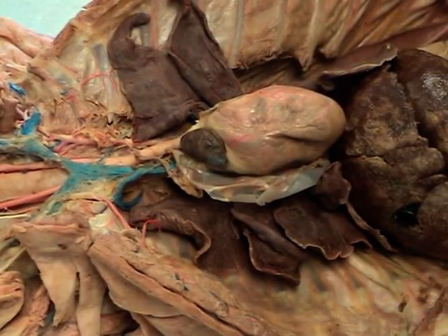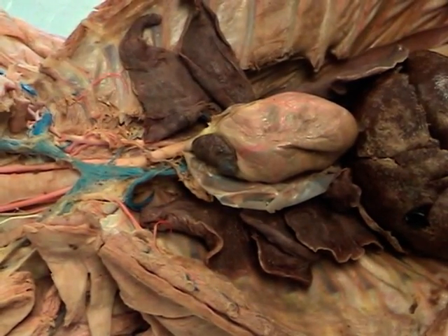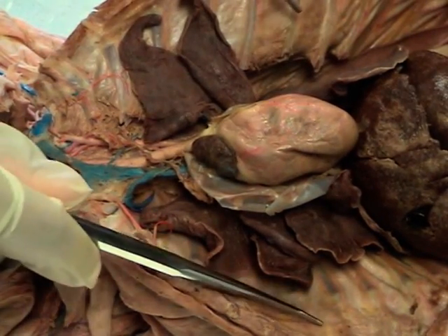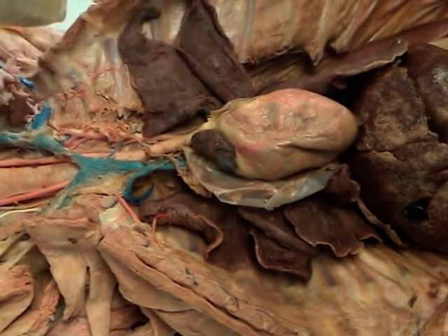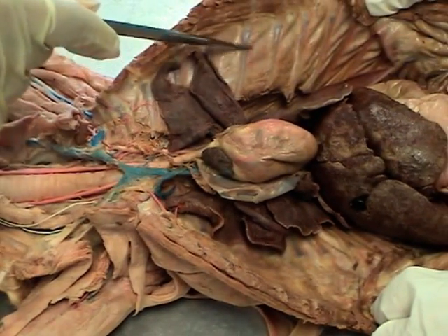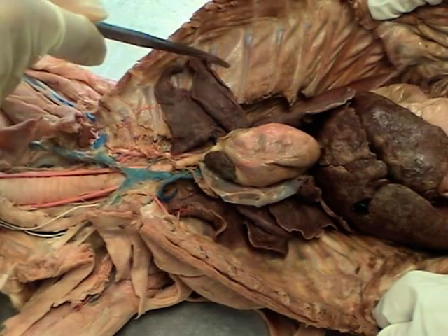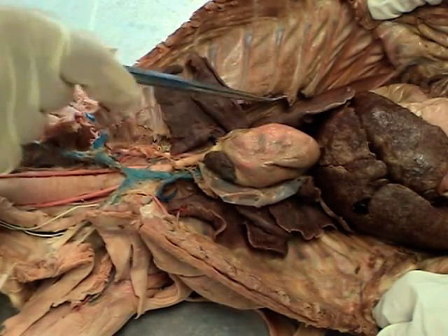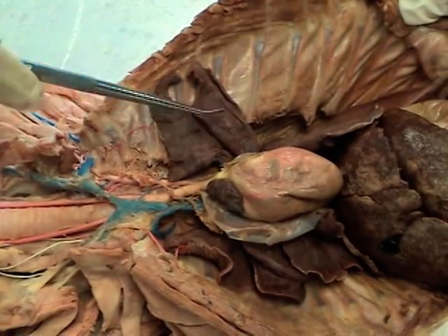We also need to learn about pleural membranes. There are two pleural membranes you need to know: the parietal and the visceral. The parietal pleural membrane will be on the internal surface of the thoracic wall — here is a transparent membrane that you are looking right through to see the other tissues underneath. If a pin is found here, you will call this the parietal pleura. On the lung itself will be the other membrane, and this would be the visceral pleura.